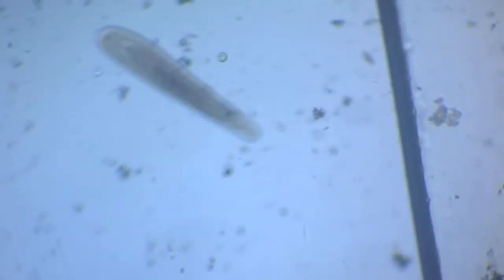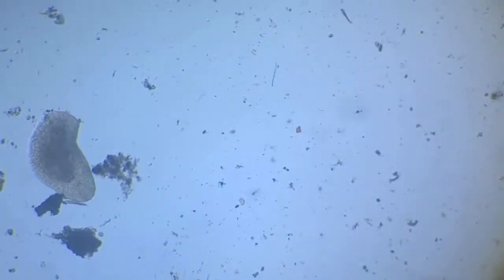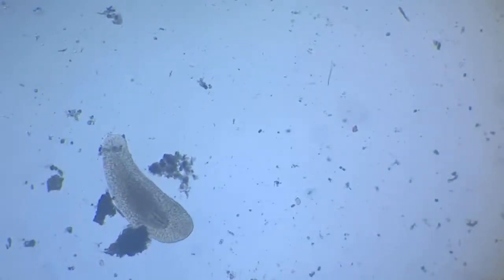Let us say, must be a planarian. It's not a larva, maybe, but to me it appears to be like a flatworm. It could be a Fasciola sort of a thing. But that worries me. If there is a Fasciola nearby, that's a sign of worry for me. Okay, now it has been showing itself in more prominence.